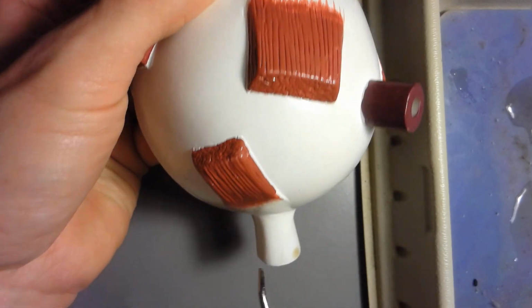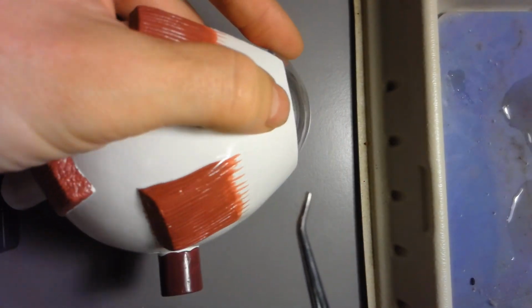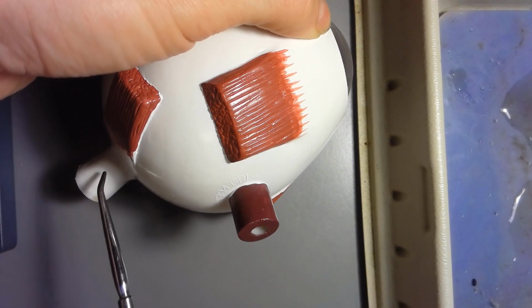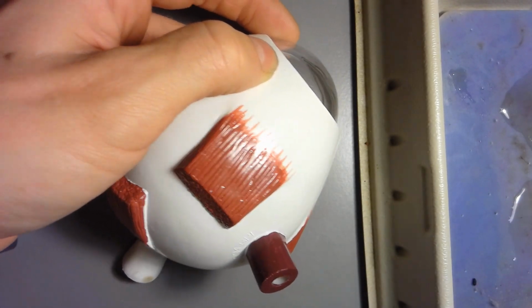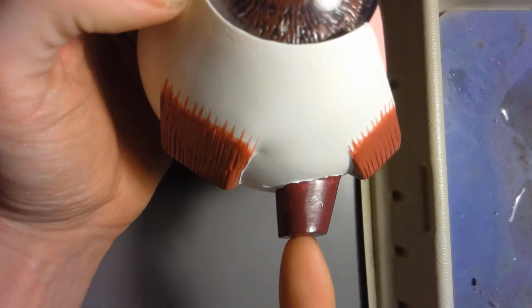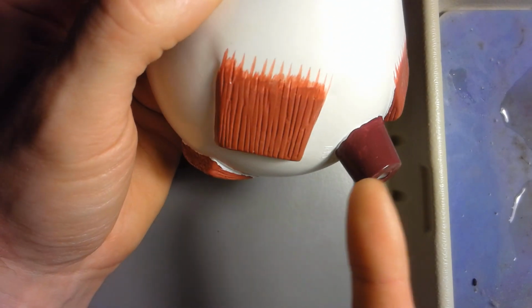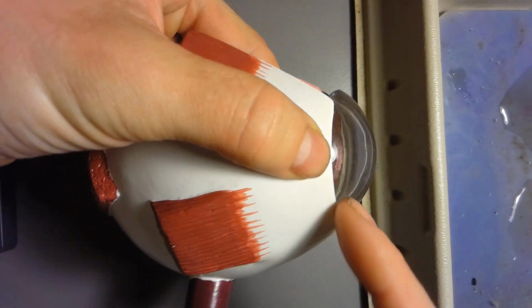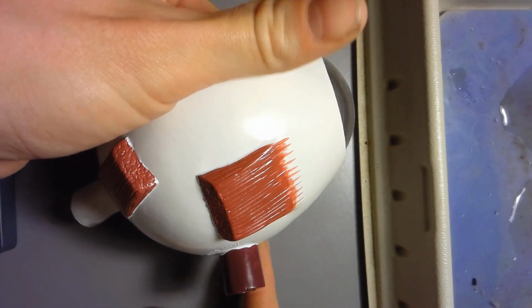Optic nerve is right here. It'll be going in, it's exactly posterior to where the cornea is. So the cornea is right here. This is where the optic nerve comes in. Ignore this. This is just where the eyeball goes into the stand. Okay, this is not an actual anatomical feature. There's nothing really anatomical that comes out from the bottom of the eyeball. So ignore that. That's not the optic nerve. The optic nerve is directly behind the cornea. So right here, optic nerve. You'll see it again with the internal part of the eye.